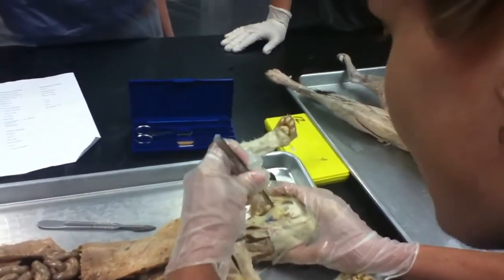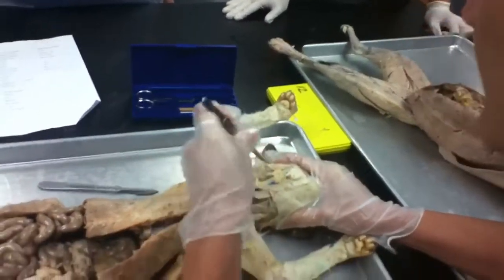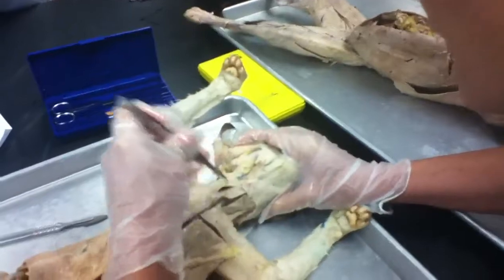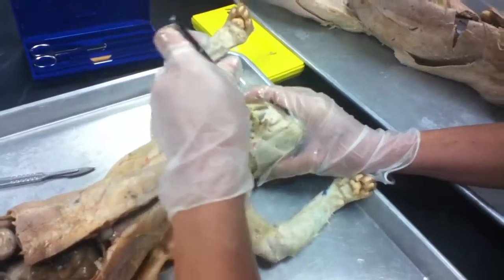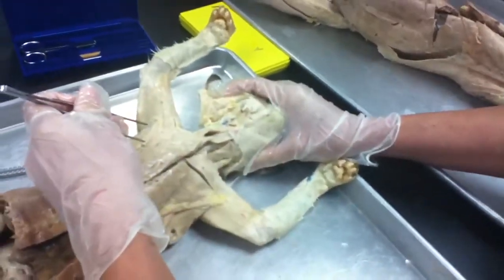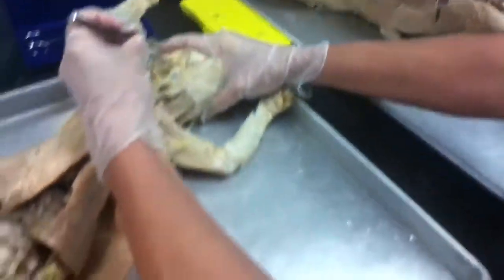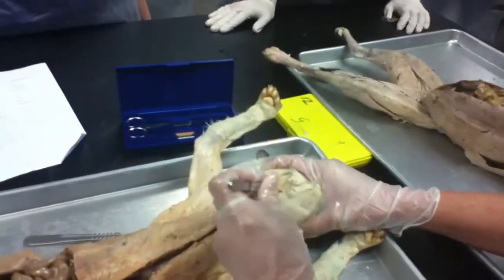And as you kind of clean this stuff out, the glands will tend to kind of pop out at you if you get into the right area. Can you see how this kind of is a ball of meat that's sitting there? Okay, so that's parotid gland. Underneath here, you have a second salivary gland. And which is the one that's located underneath our jaw? What's the name of your jaw? Mandible. So mandible. So under the mandible, submandibular. So we've got parotid right here, submandibular, and then located kind of underneath this vessel here.